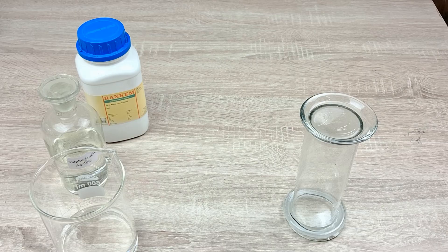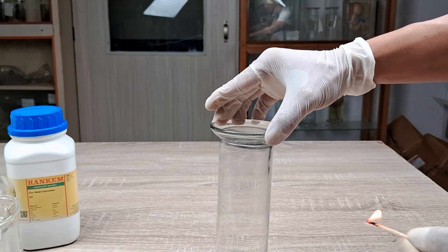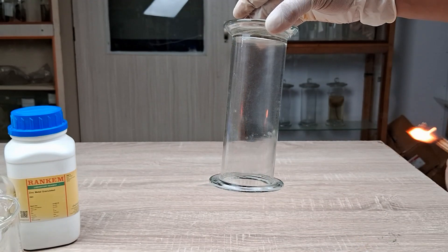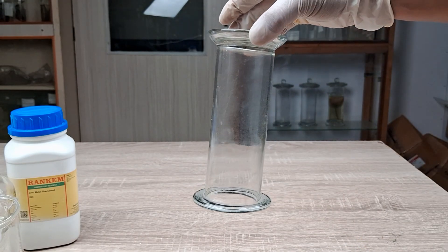Next, light a matchstick or splinter. Remove the glass lid from the gas jar and introduce the burning splinter at the mouth of the gas jar. Record your observation.